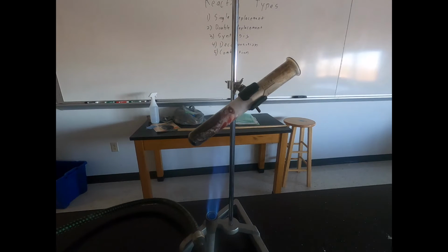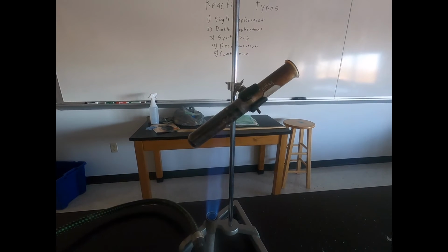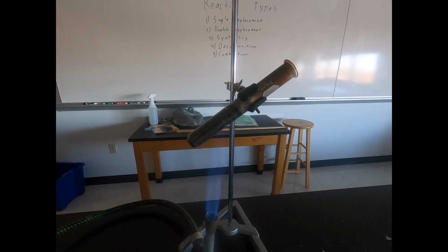So for that reaction, we had the decomposition of the potassium chlorate, which created some potassium chloride and oxygen gas. Then by adding the gummy bear, that gummy bear had some sucrose in it and some sugars, and those sugars then reacted with oxygen that was created from that decomposition, and that's what caused that flaming gummy bear. So that's an example of a decomposition, and we saw a little combustion on that as well. But we were looking for that decomposition and the production of oxygen gas.